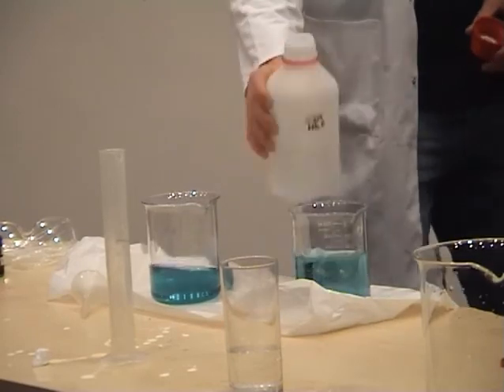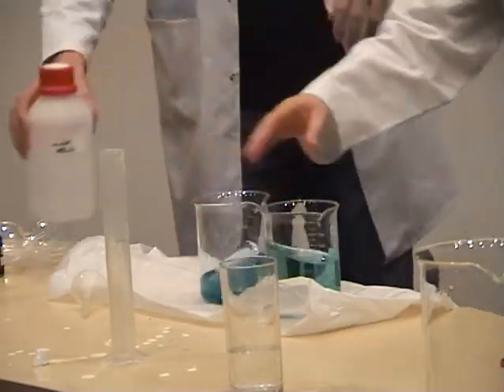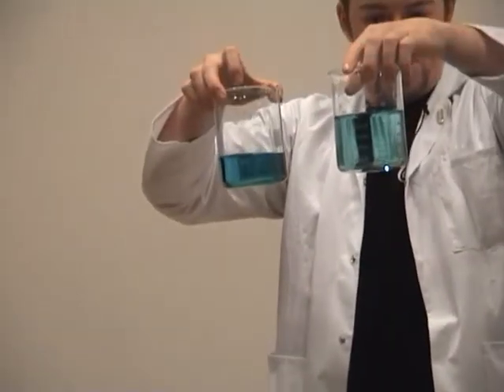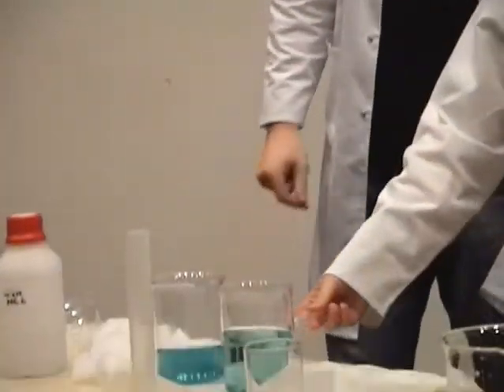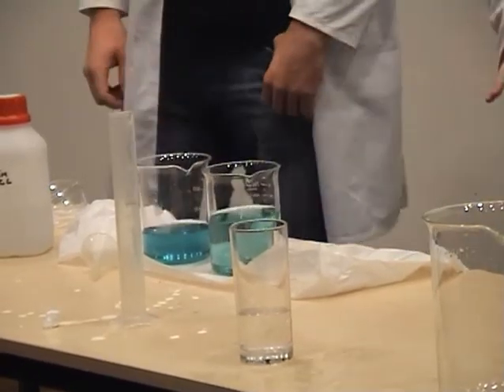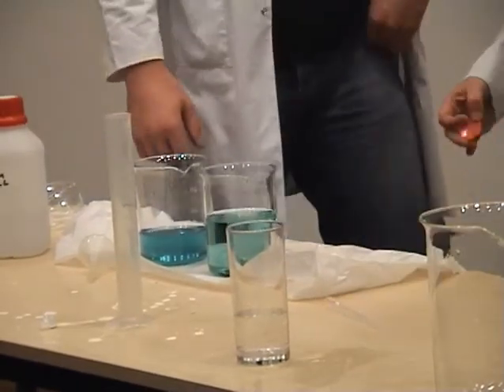Oh, wow. For a tiny additional drop of buffer, it took less than two pipettefuls of extra acid to make the base change from a base solution to an acid solution. And that's how the buffer will work.